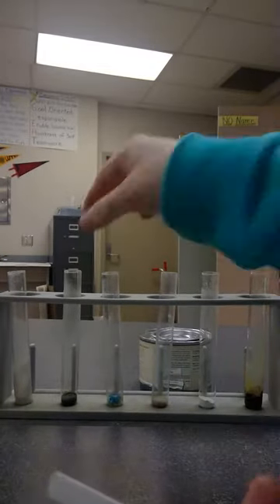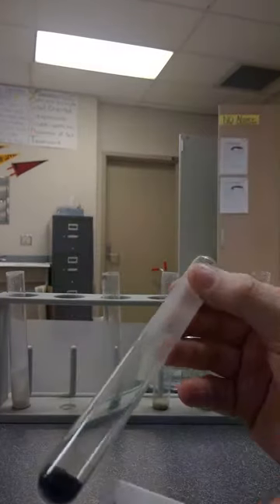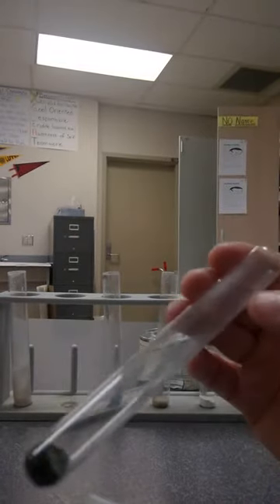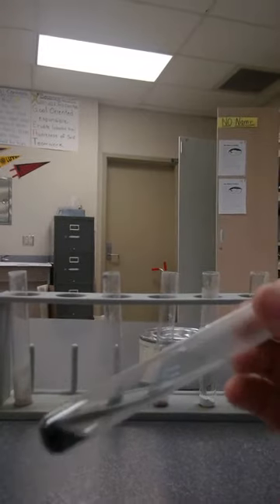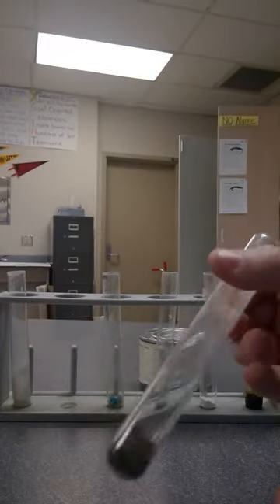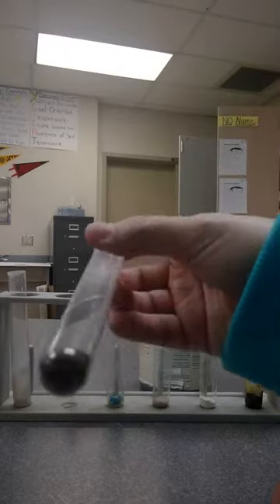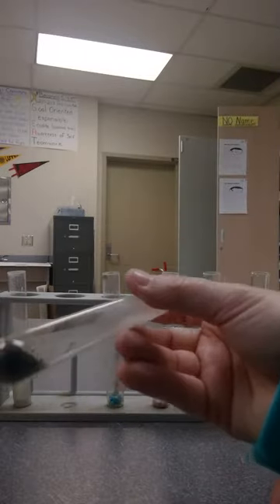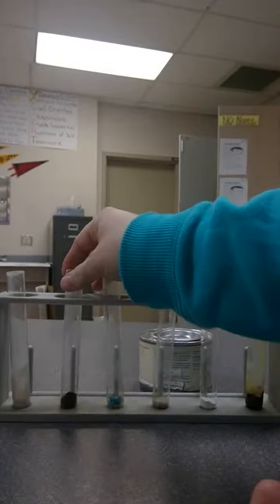Next we have our copper carbonate. The part that turned black is definitely still black — it's also still very powdery, turning into a kind of black powder as I move it around. So it's not changing back. It looks like once it's changed in color and been heated, it is a permanent change.